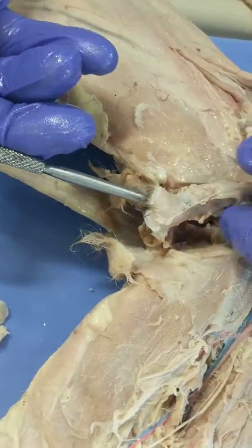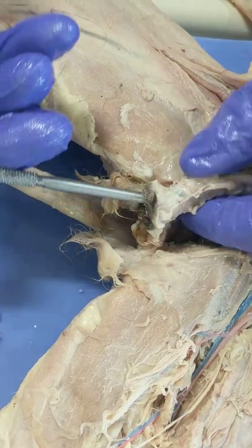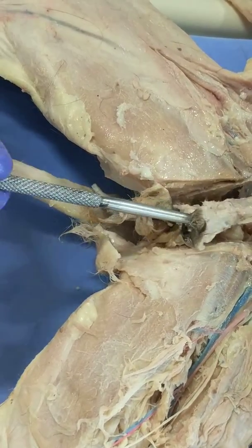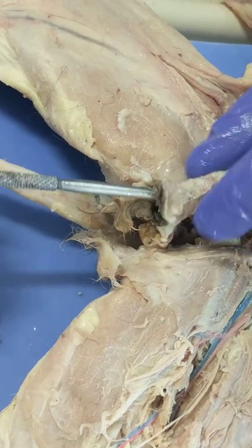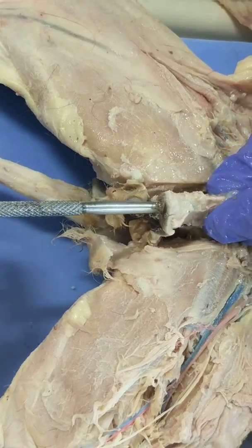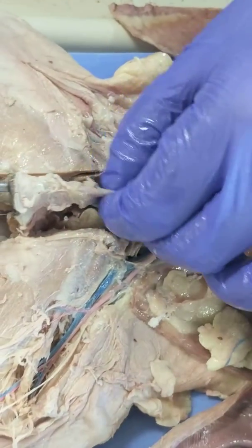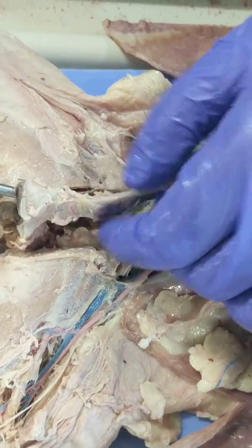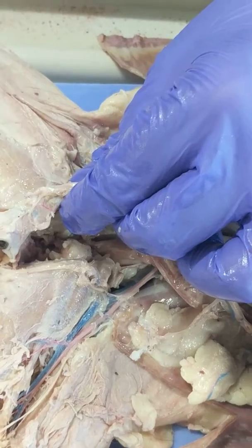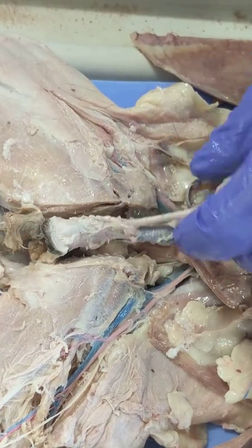So there's one opening for both the reproductive system and the urinary system, right here. I can put the probe either up into the urethra — I can't get there really, it's too curved — or into the vagina.